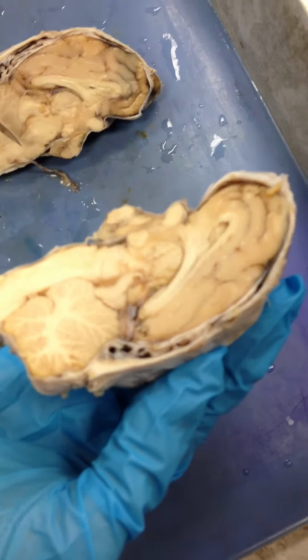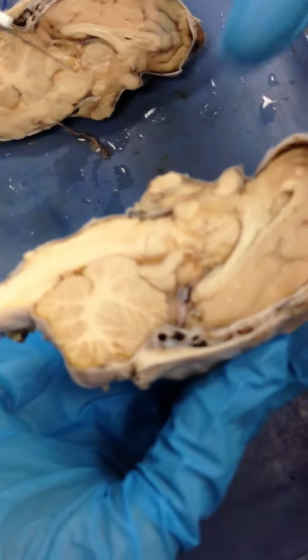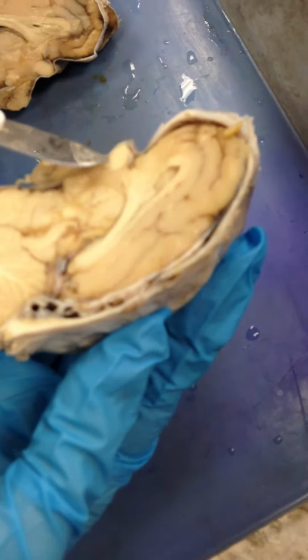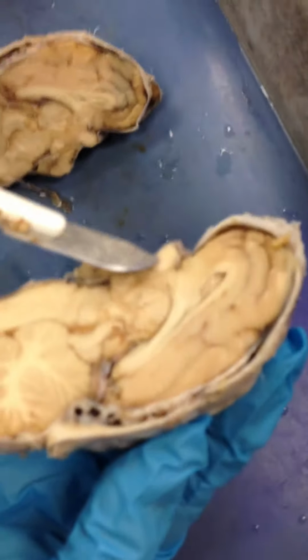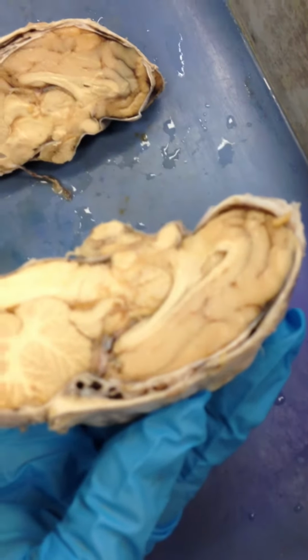Okay. So the optic chiasm and the optic nerve are at the bottom. Oh, that's what he said that was. Where's the nerve? The nerve is right above it, so it'd be like right here. Wait, where's the optic chiasm? This right here. And then like right here would be the nerve. Okay.